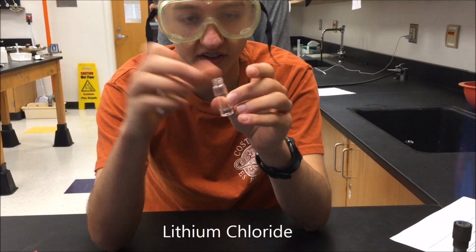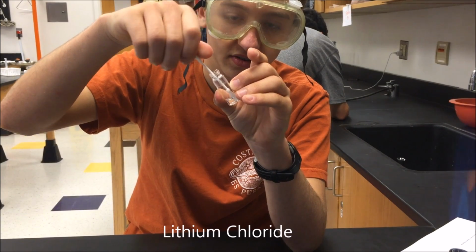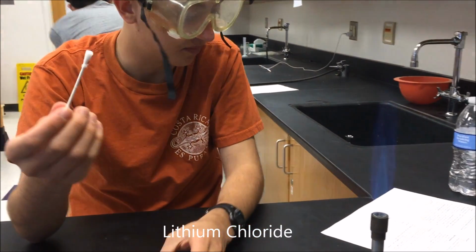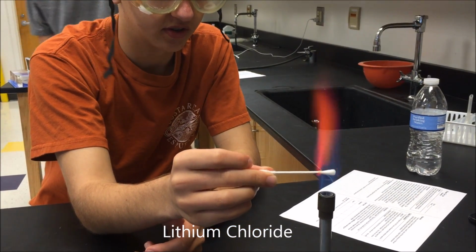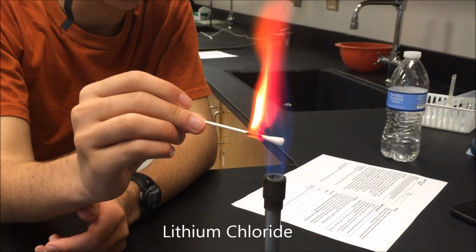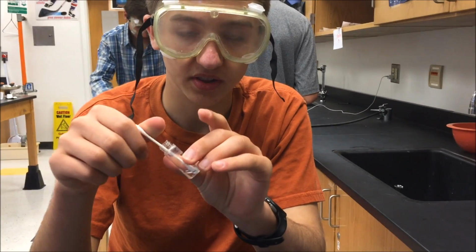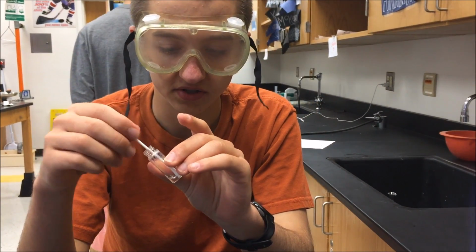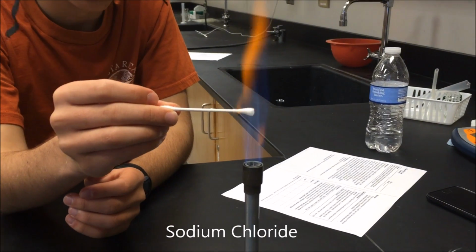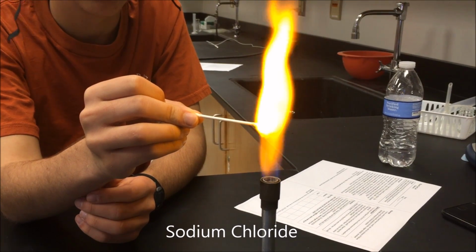Dip the cotton swab inside of the lithium chloride solution, making sure that the tip gets fully wetted. Then, place the Q-tip over the flame and observe the color produced. Lithium chloride seems to burn a bright red flame. Repeat the process with each of the 6 solutions. Next, we are using sodium chloride. Over the flame, sodium chloride produces a bright yellow flame.